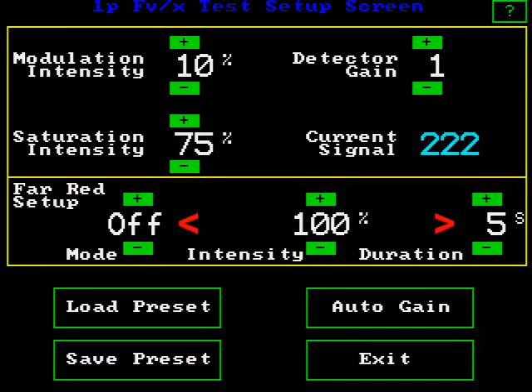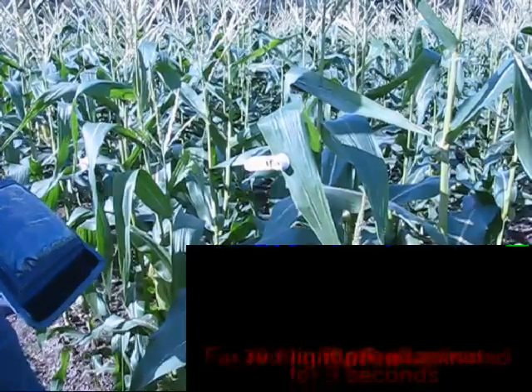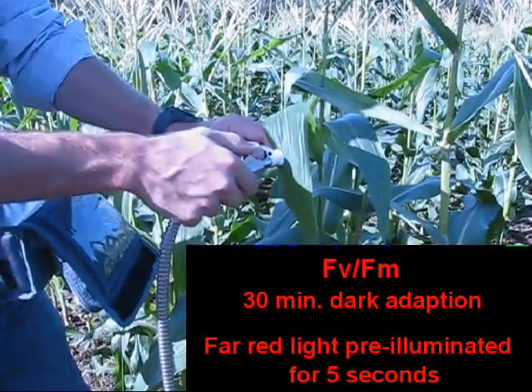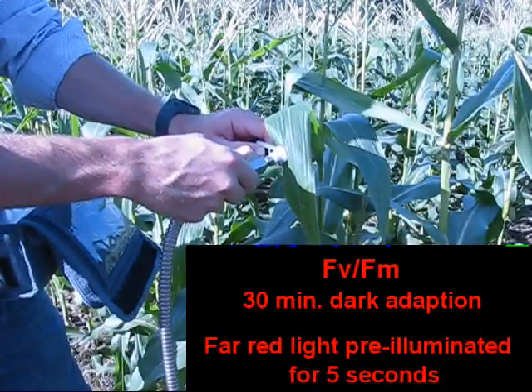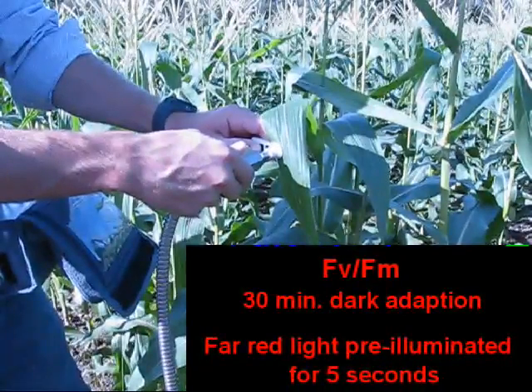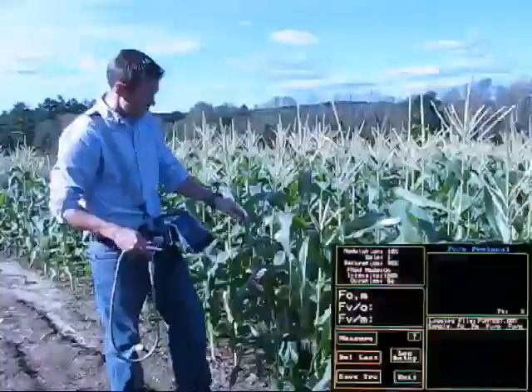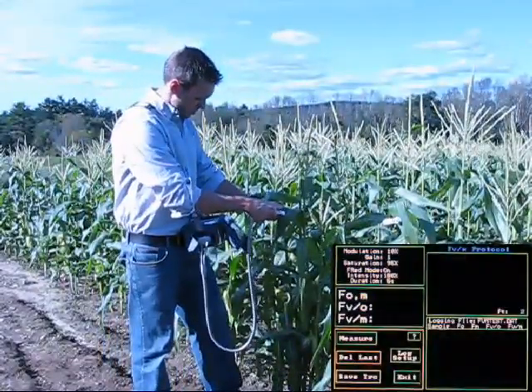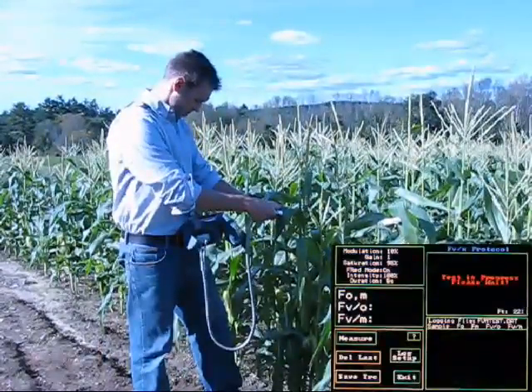These screens show a far-red pre-illumination for 5 seconds. In this clip, an Fv/Fm measurement is made using the OS-1P and dark clips. The sample was dark adapted for 30 minutes and pre-illuminated with far-red light for 5 seconds. Here is the OS-1P in action making Fv/Fm measurements. Measurement values are displayed, and the measuring trace confirms that the measurement was done correctly.